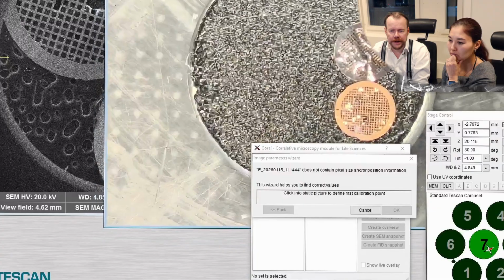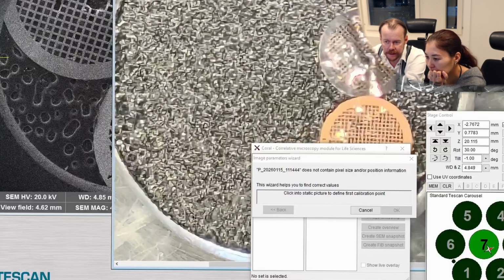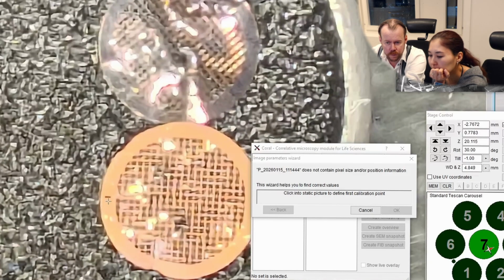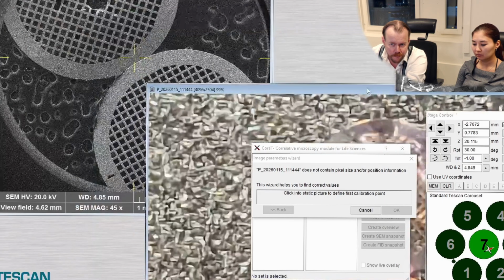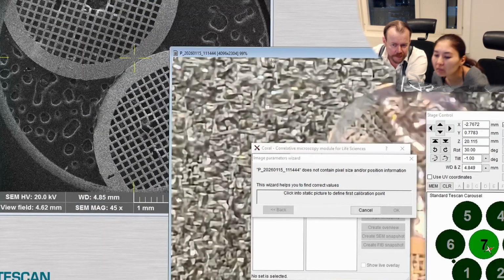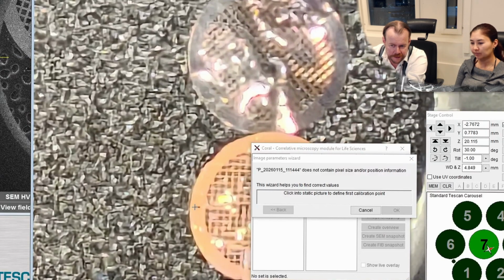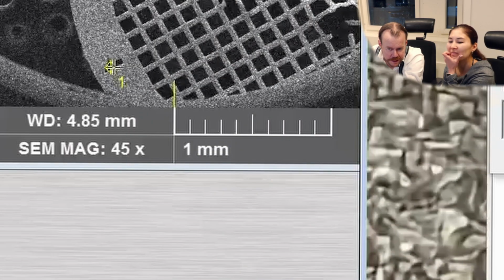And now we want to calibrate this, and so what we want to do is mark out features that we see here that we find in the SEM image. So we do that by putting out like 2 points. And then you see all grids, they have a number in the corner here. This is actually a number 1. You can see there it says number 1. I see. Okay. So that is a nice thing we can identify. So let's take the edge there. Now it became a mark there, you see? And then we click in the SEM image. Where do we see that? Here. There it is.